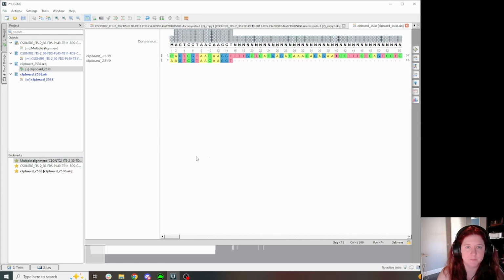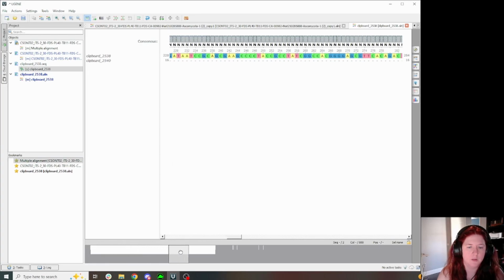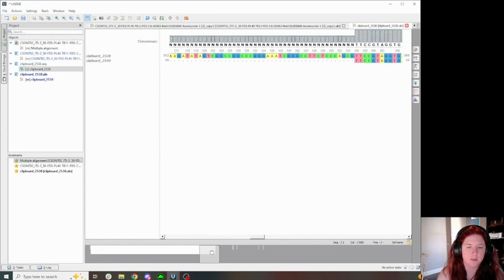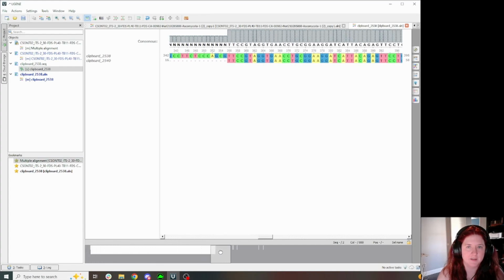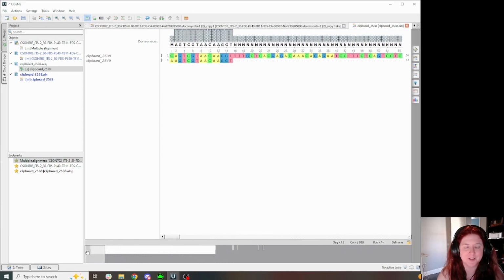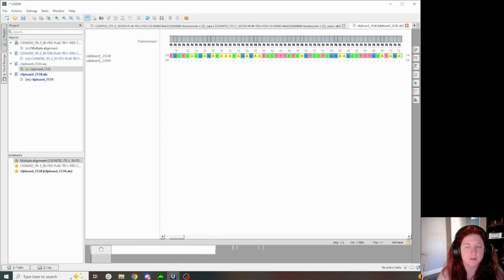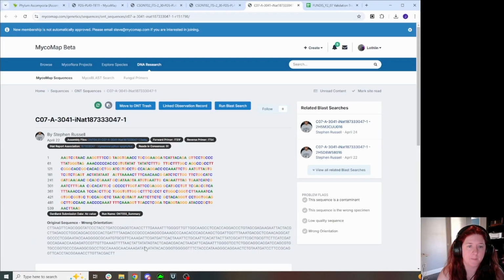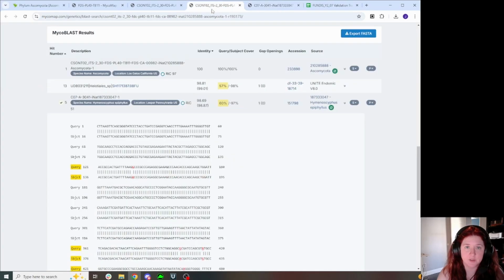And look at that. This right here is the group 1 intron. It aligns nicely after it, and it aligns pretty nicely before it. And there's just this nice little chunk in the middle that isn't aligning. So with this ascomycete, I'm going to leave this intron in here. I think it's good information to keep, right?